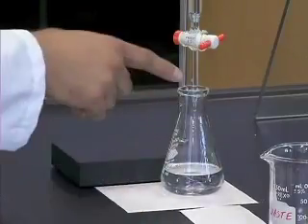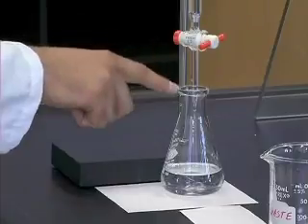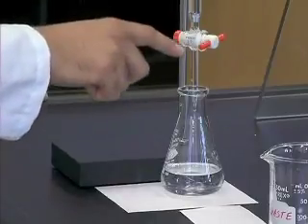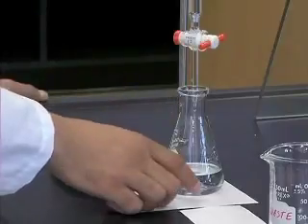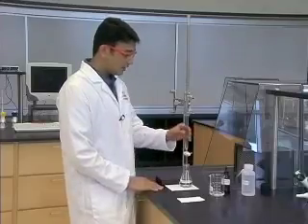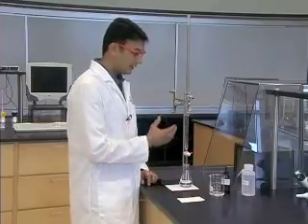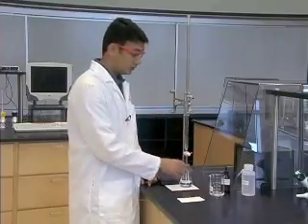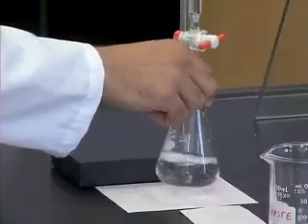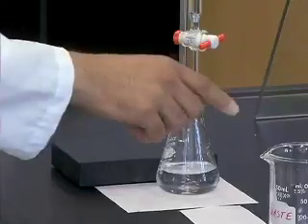It is important to note that the tip of the burette is below the top of the flask to ensure that the titrant from the burette is completely collected and contained inside the flask. Also keep in mind that we will be mixing our analyte with the titrant using a swirling motion of the flask. Hence the tip of the burette should not be so far down that it hinders the swirling motion.